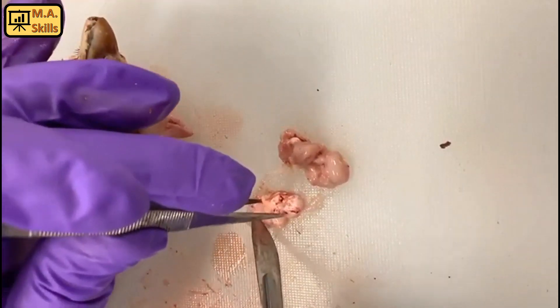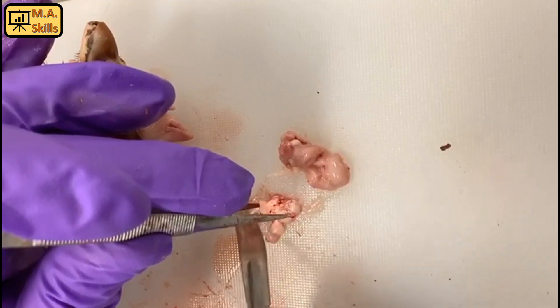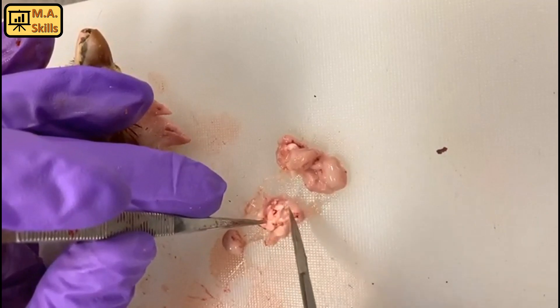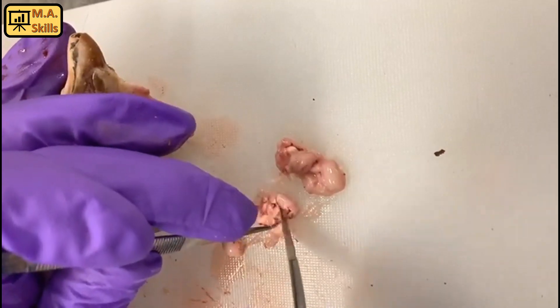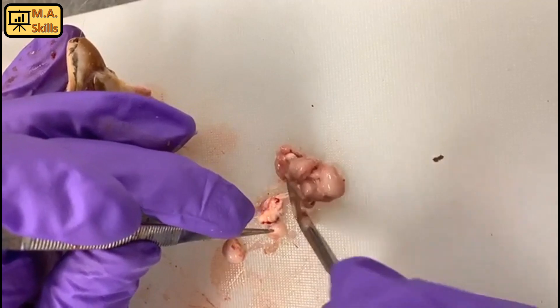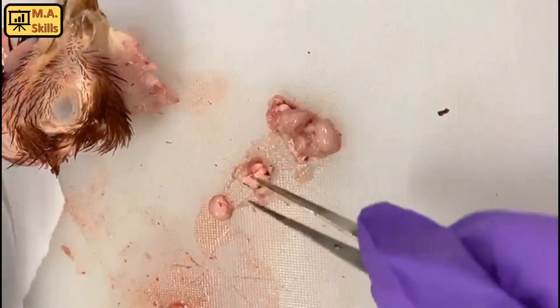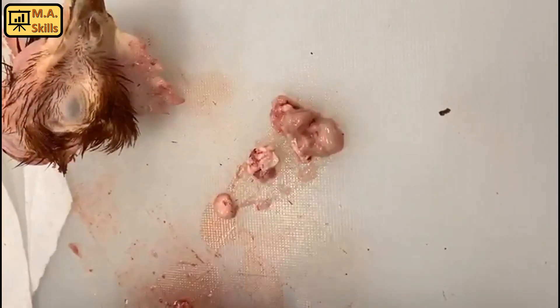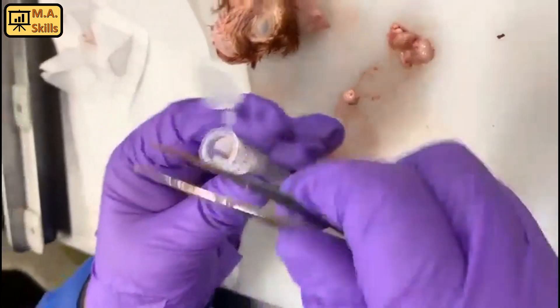Here we have the optical lobes — two optical lobes. One is here for the mesencephalon, and we need to cut them out. The hypothalamus is located inside the middle part, and we are going to take the sample.